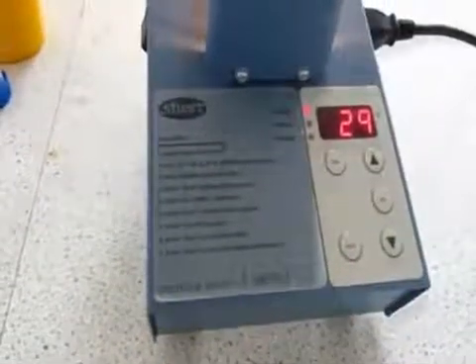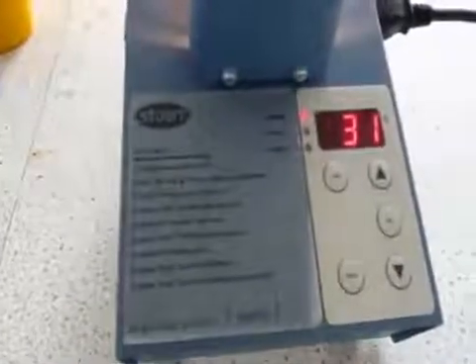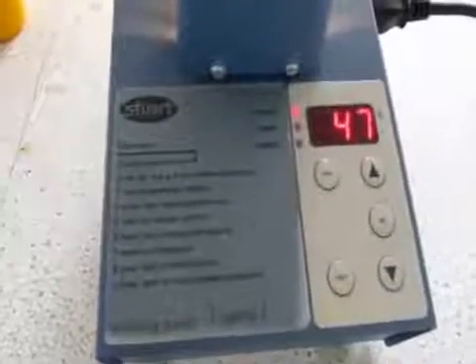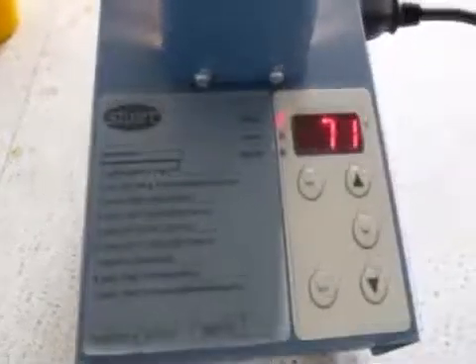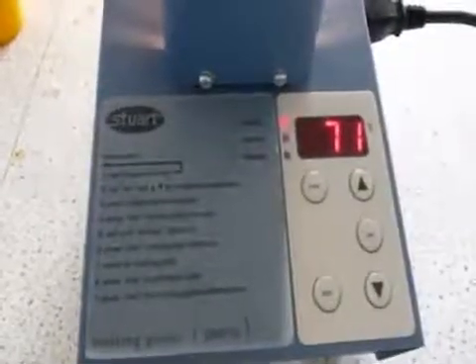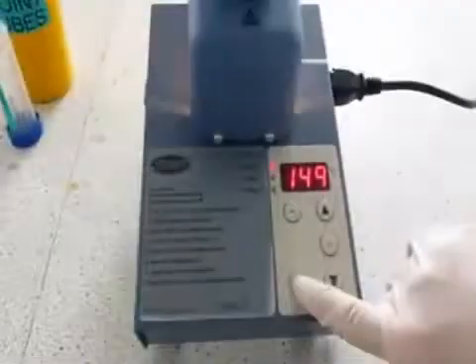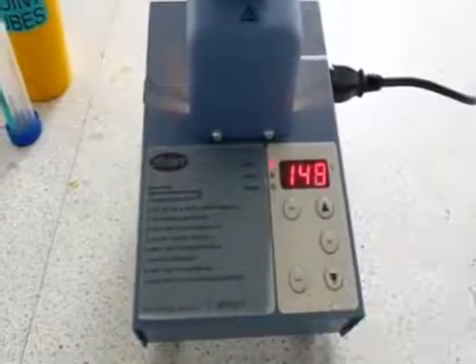Press start and wait until the plateau light is on. When the plateau light comes on, press the start button again and the ramping light will come on.